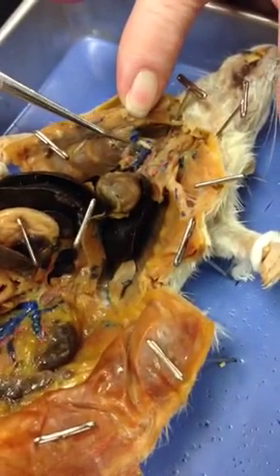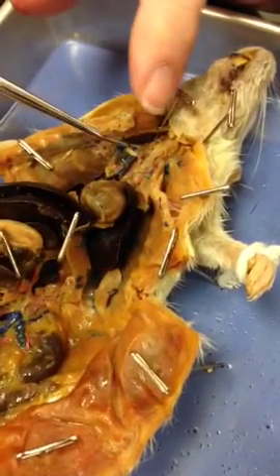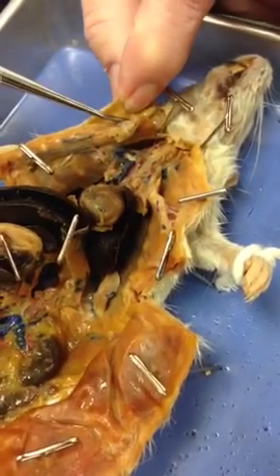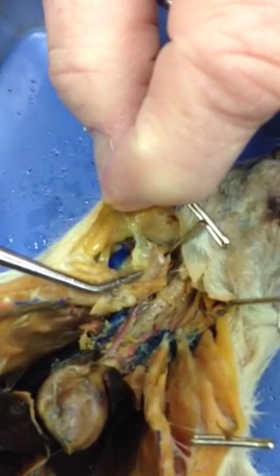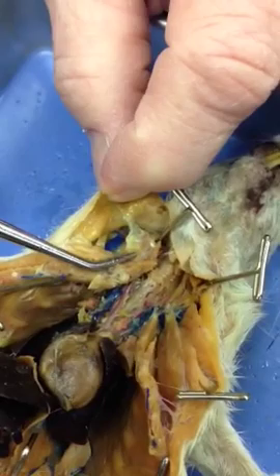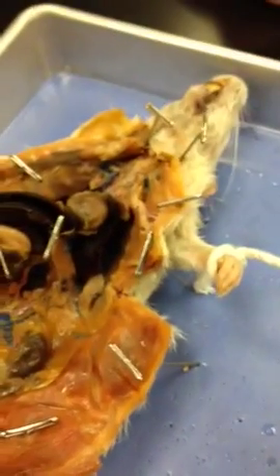And then coming off of it would be your subclavian, and then going up or coming down from the head would be the jugular. And the best way to see the jugular is here, because their external is big. Yeah, they have big externals, whereas we have small externals, large internals. They have large externals, small internals. That's basically it.